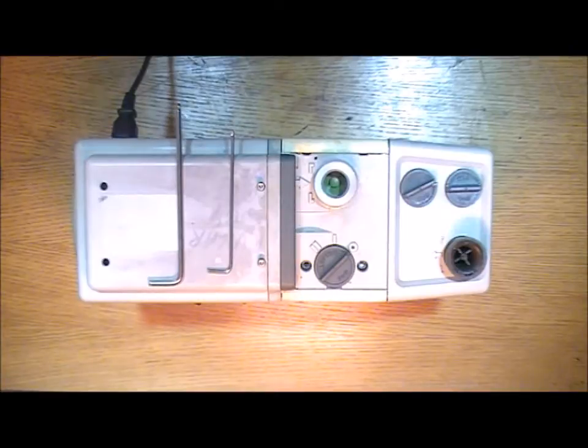And I'll show you as we go through the spare parts that you're going to need and exactly how to fit them. And then at the end I'll put up a card that shows you the part numbers should you need to order any of these things.